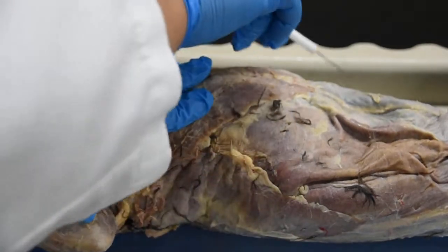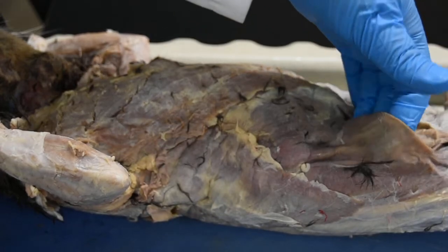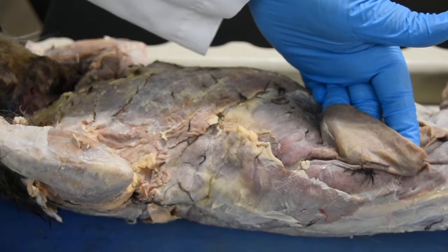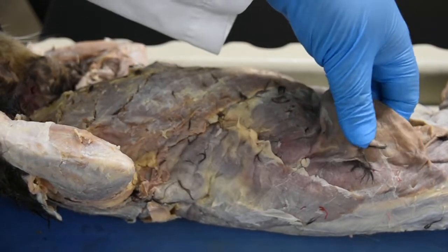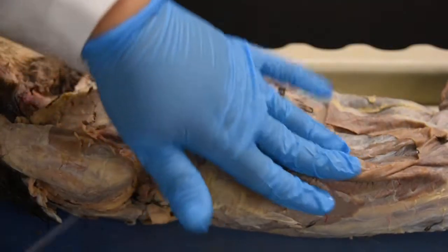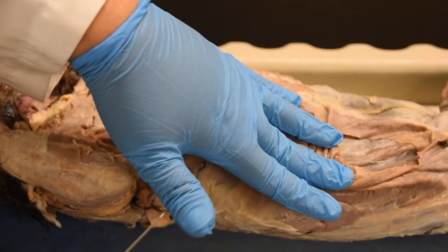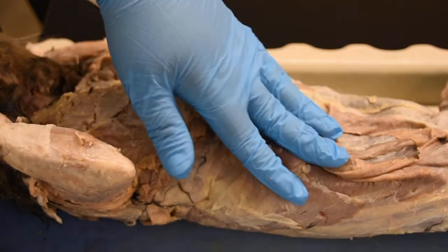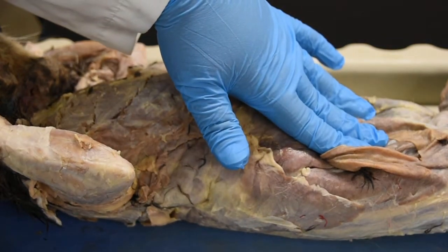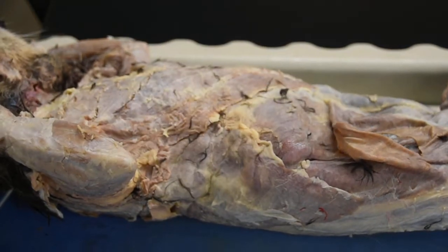On either side, on the most superficial aspect, we have a very thin layer of muscle. You can see it separated. You have muscles underneath it, and then this is the really thin muscle. This is called the external oblique. And again, if I push this back and look at what's underneath it, you see another layer of muscle, which is your internal oblique. Now in reality, you also have another layer of muscle underneath the internal oblique called the transverse abdominis, just like humans, but it's not depicted here.